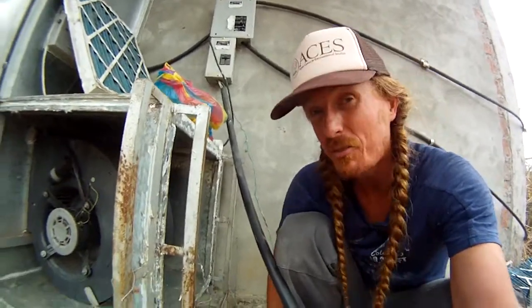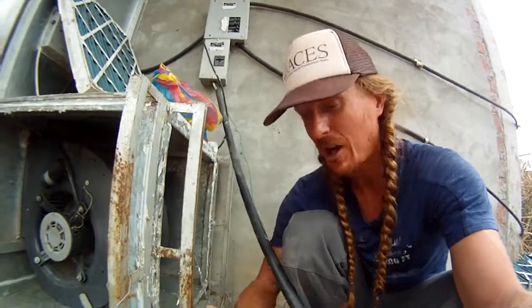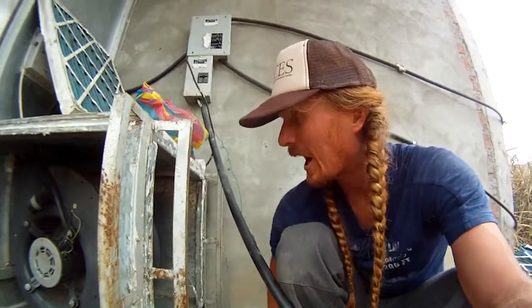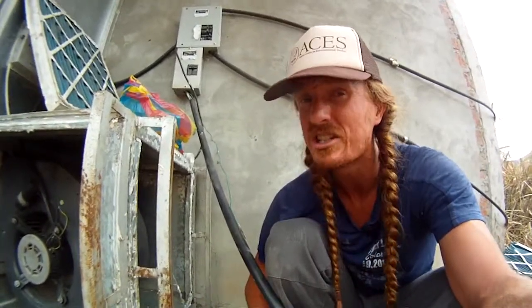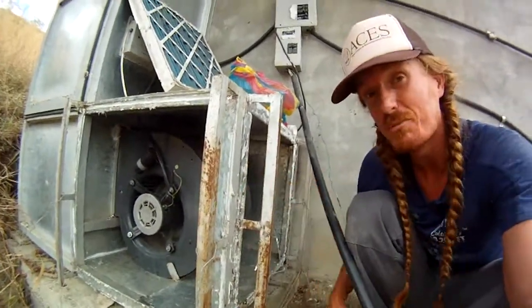Positive pressure means the pressure inside the lab is greater than outside, so air is actually blowing out any hole. Of course, everything is ideally sealed up, so really the only holes are under the door jams, and it's actually kind of physically hard to shut or open the door, depending on which door it is. I have three doors just to get into this thing. The positive pressure means no floaters can accidentally float in the door jam, and it resists a lot of insects from going in, and then you have sticky mats as well. It's a full-on operation here, gang. So this is the inside here. It gives you a good idea. It's a nice big blower.